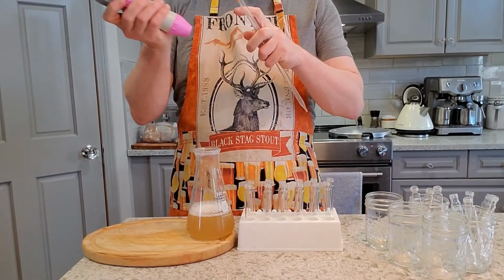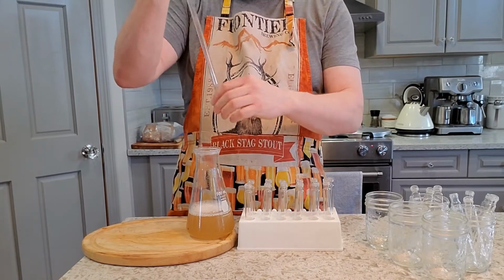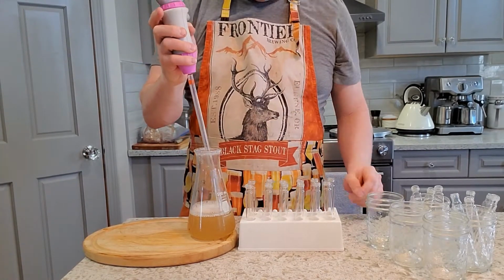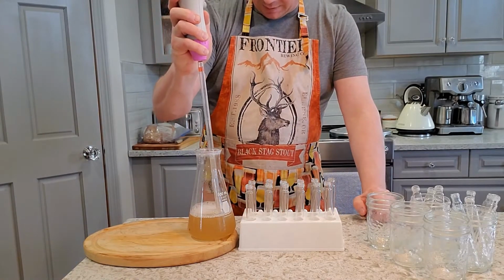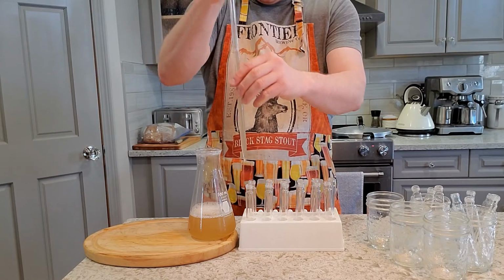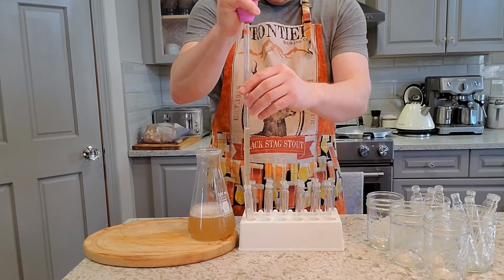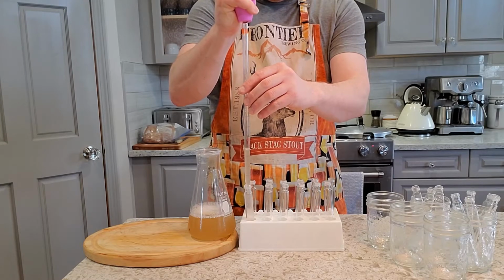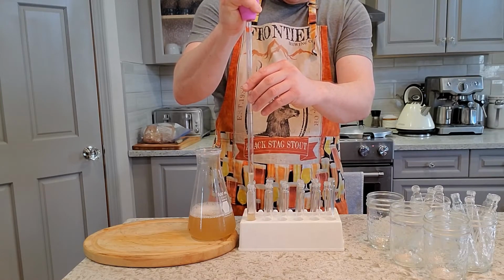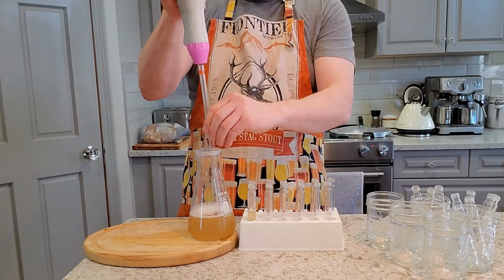All right, so you can use just a regular pipette for this if you want, but I really like this auto pipette. I've had this, again, since the beginning of my yeast lab, and it just makes everything super, super handy. So I'm just going to be picking up 10 mils and putting it in. We're not worried at all about sanitation or anything at this point because we are going to be pressure canning it. So just filling them all up.